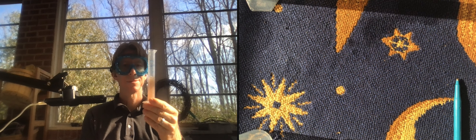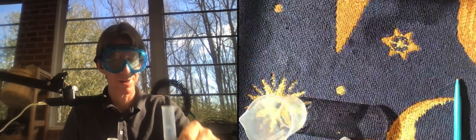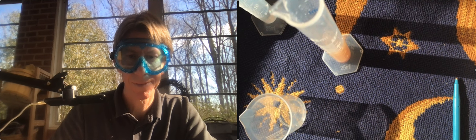This has a gelatinous mess - we're not going to be able to see anything from that. It doesn't smell like vinegar anymore. At least we've got our sodium bicarbonate ready. Let's stop for a minute while I figure this out - what's the name of the sodium bicarbonate?